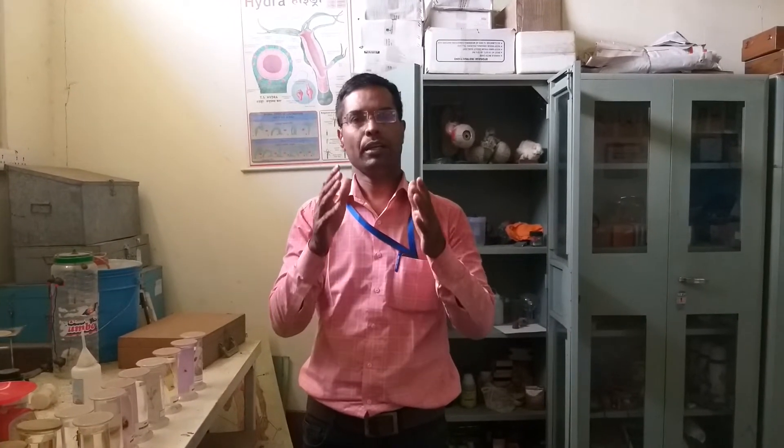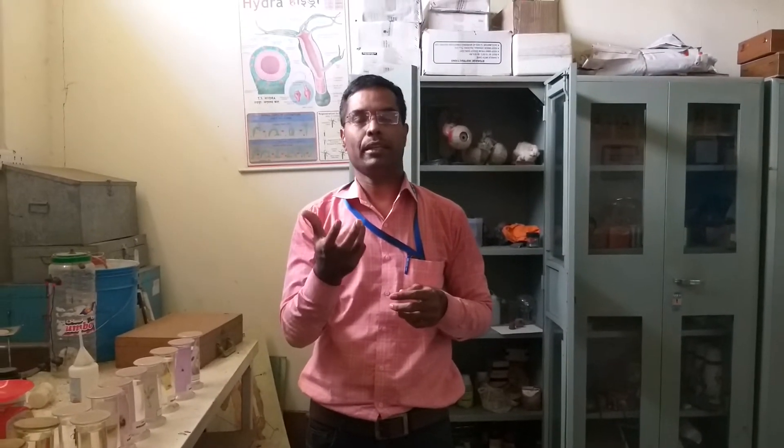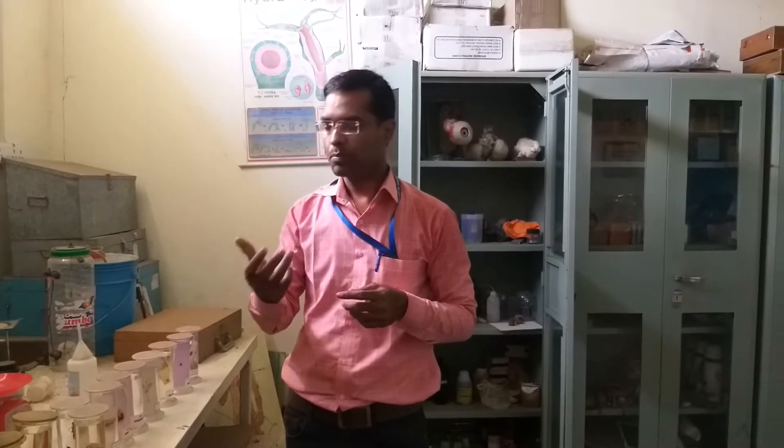Dear students, in our 10th standard we are having the topic animal classification. In this animal classification, we have to study the characteristics of the organisms from some phylum and some class. Now in animal classification, we have to observe the specimen and identify their characteristics. Therefore, we are today in our laboratory to observe some specimens of the animals.